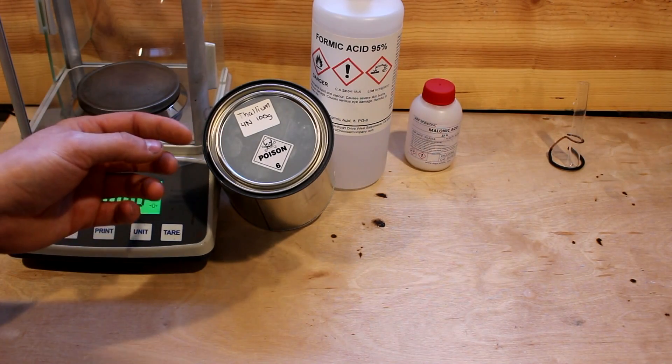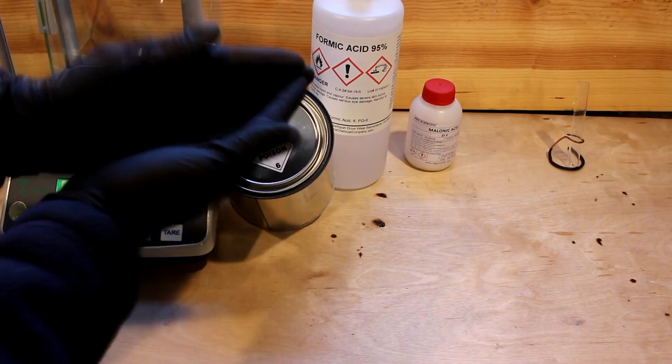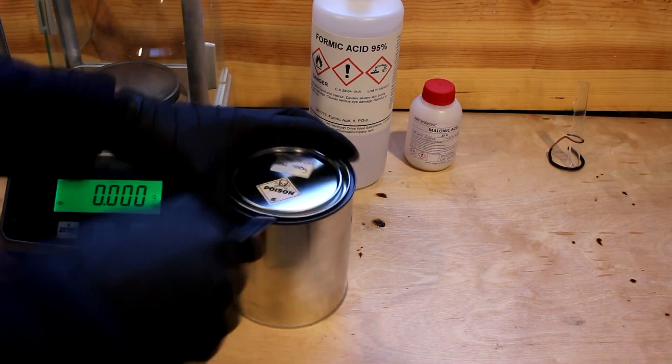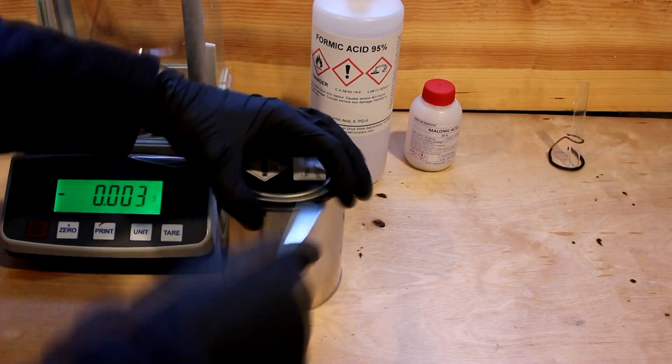But I should be all right as long as I don't try to eat it and also keep it off my skin whenever possible. So without further ado, let's crack this jar open and see how it looks.